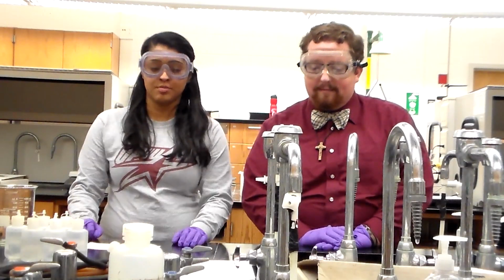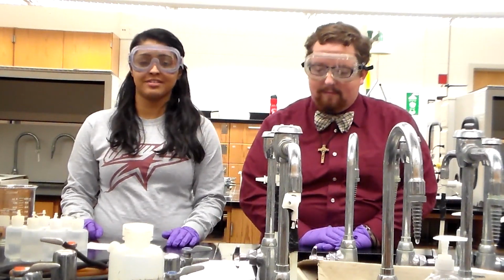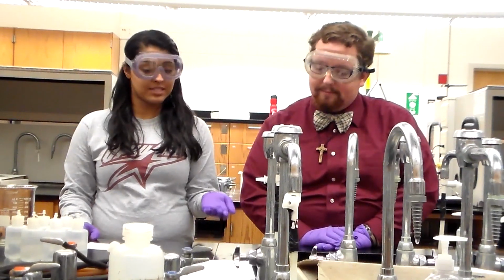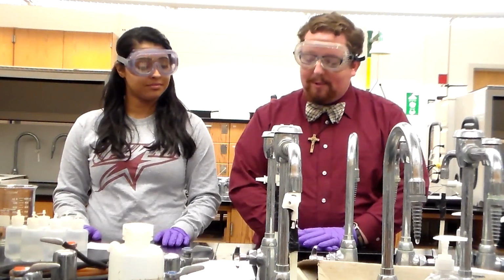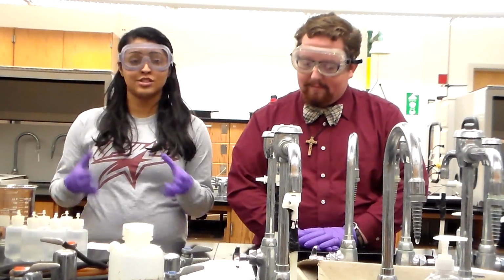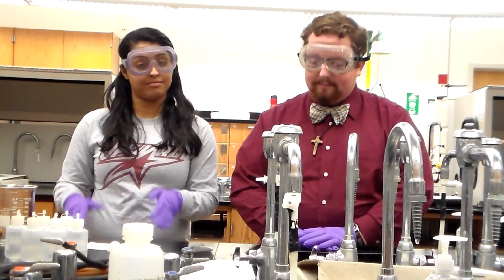In today's lab, you will be determining the identity of unknown amino acids by using paper chromatography. Chromatography is a method to separate mixtures based on their differences in affinity for the mobile phase and the stationary phase. The mobile phase is solvent that will move up the stationary phase, which is the paper. The distance that the amino acids on your paper will travel depends on their size, structure, charge, and polarity. Since every amino acid has its unique structure, the distance traveled by each sample will also be different.